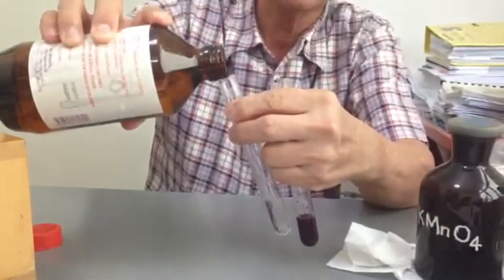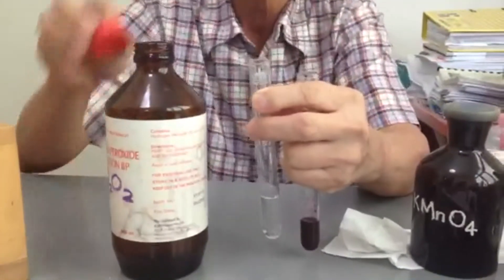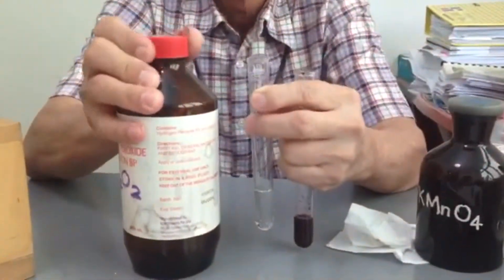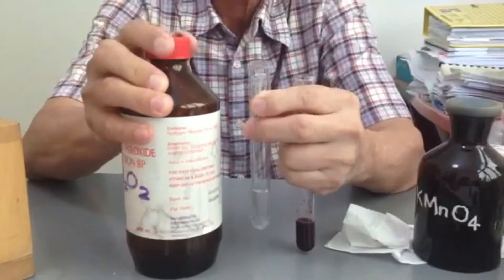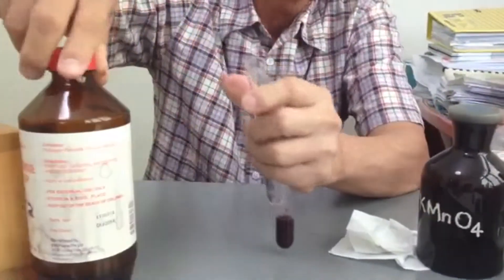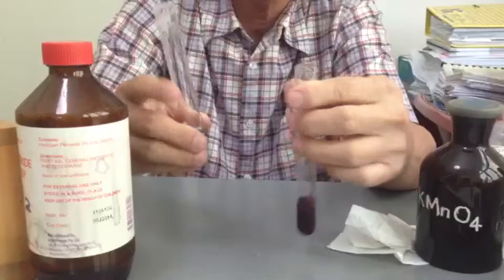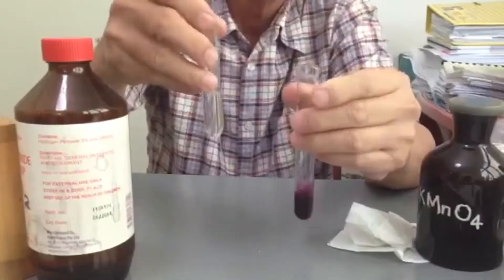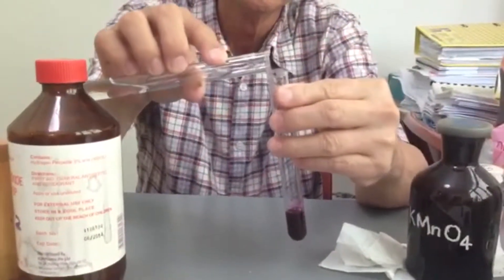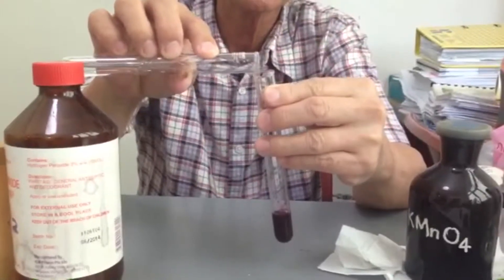It is sold by Guardian pharmacy — you can buy hydrogen peroxide there — except now it is not allowed to be brought into the lab. We'll explain why some other time. So now I'm going to pour this in. Ready?